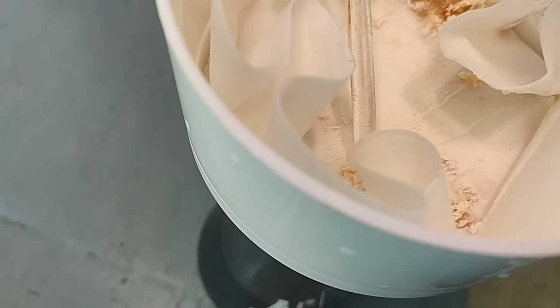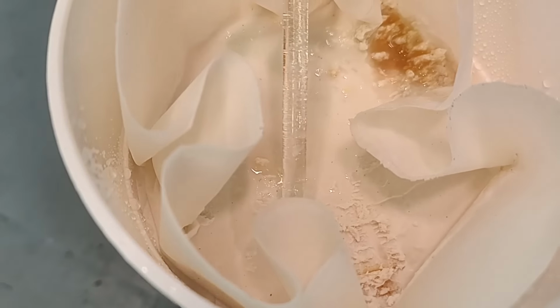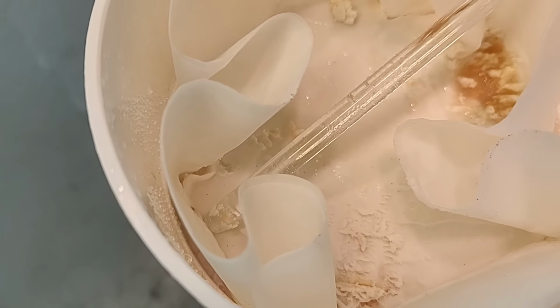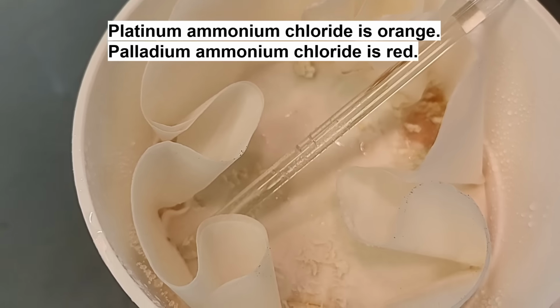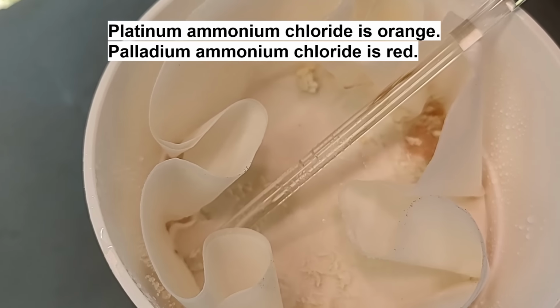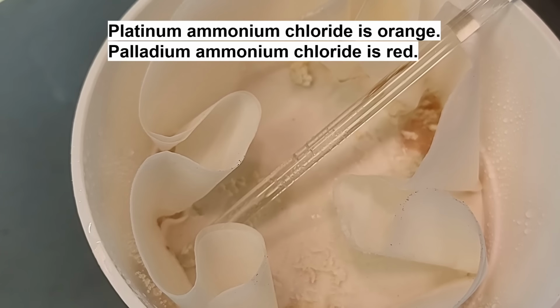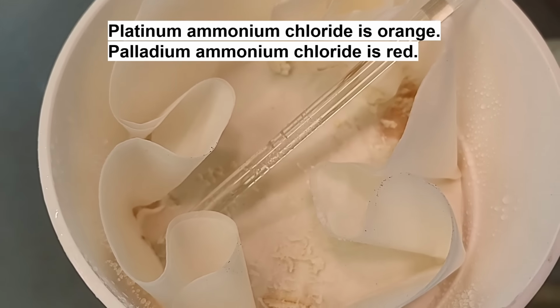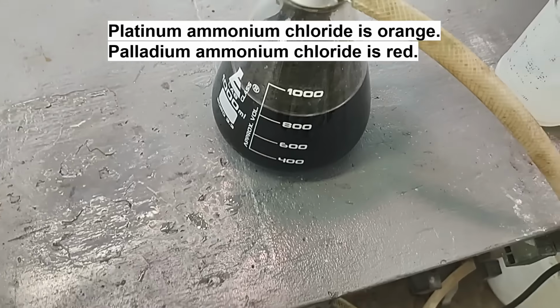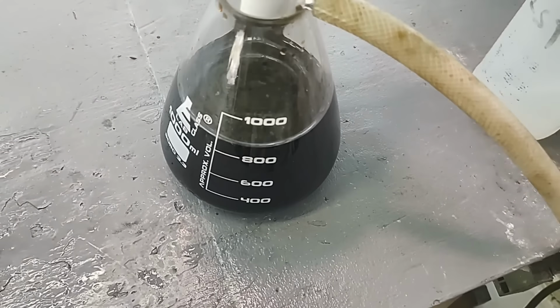And it is not rinsing through. It's not dissolving and rinsing through. I suspect we've got a little bit of platinum salt here with our palladium salt. I suspect we've got a little bit of platinum ammonium chloride up here. It's not dissolving. But the palladium ammonium chloride went right through.